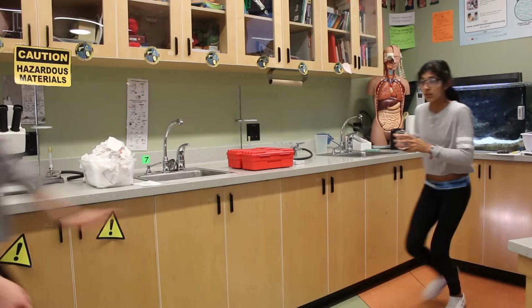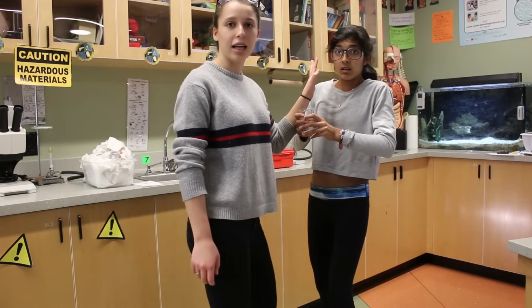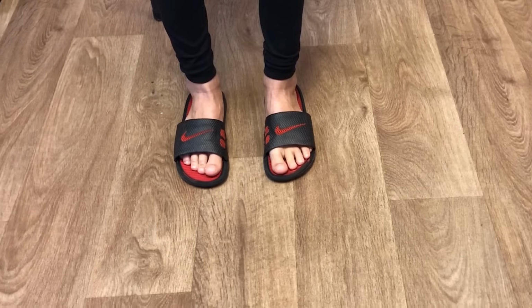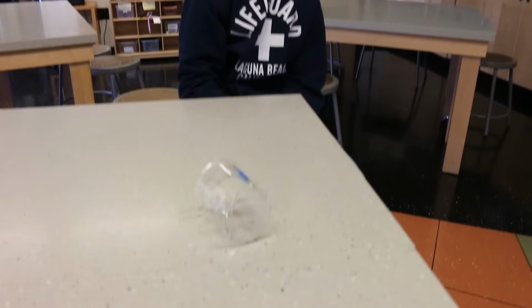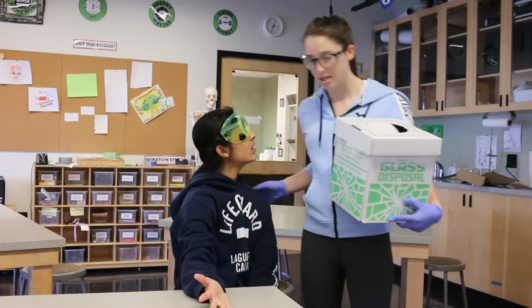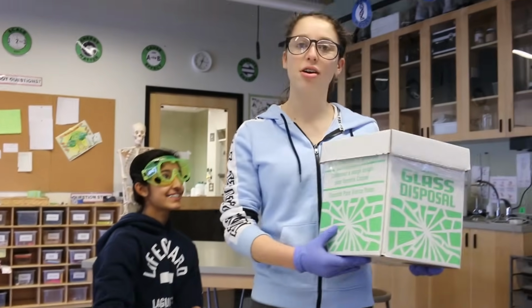Don't you run with that glass beaker. Do wear those closed-toed sneakers. Make sure you call a teacher if there is a break or spill. No!